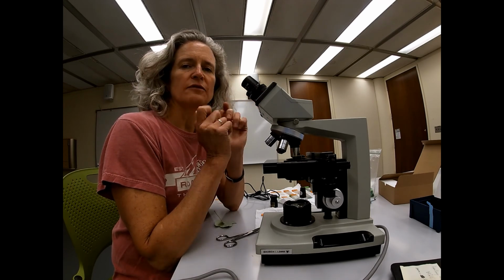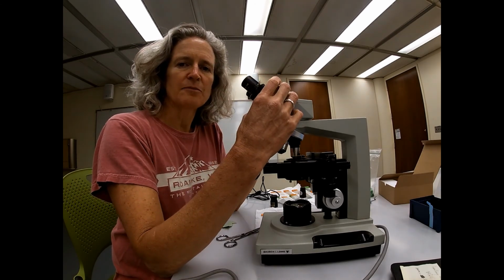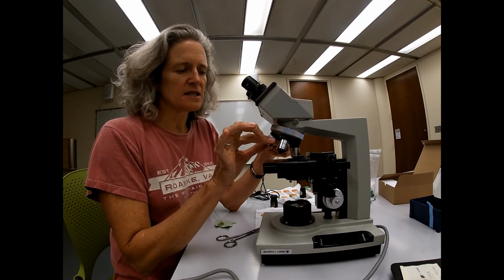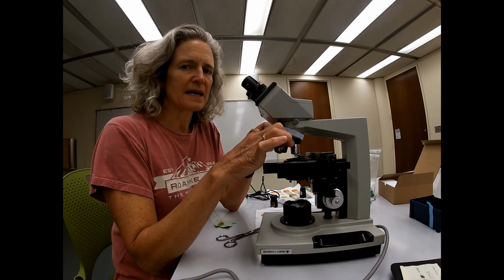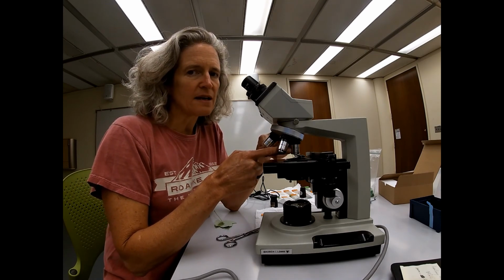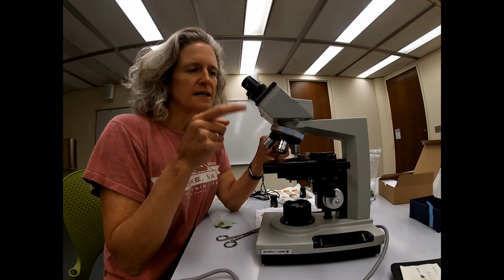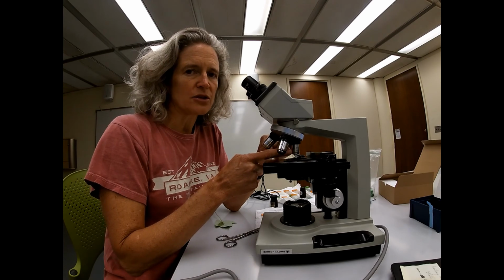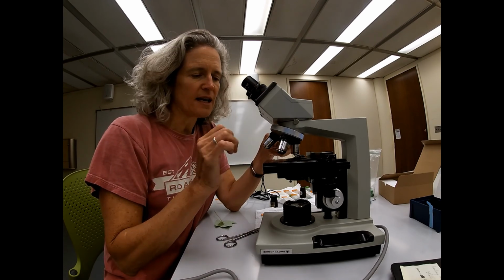They have their own level of magnification, and they are attached to the headpiece, which then attaches to the objective lenses. These objective lenses rotate. They have different levels of magnification. So the smallest level of magnification is 4x. So that's enlarging it 4 times its natural size. The ocular pieces are each 10x. So you multiply the 2, that's 40 times larger than you could see with your naked eye.